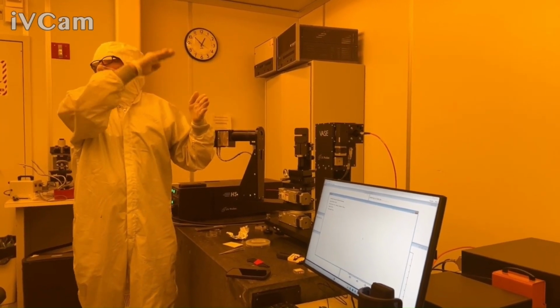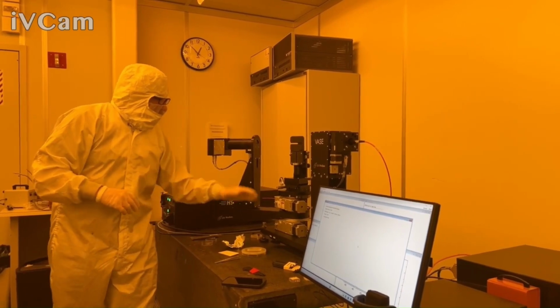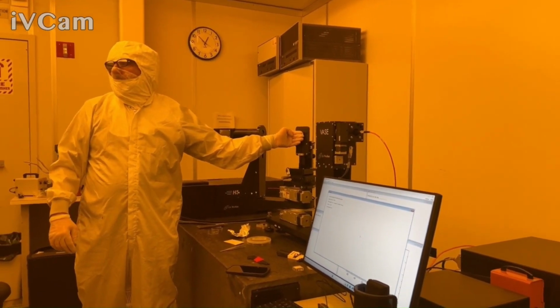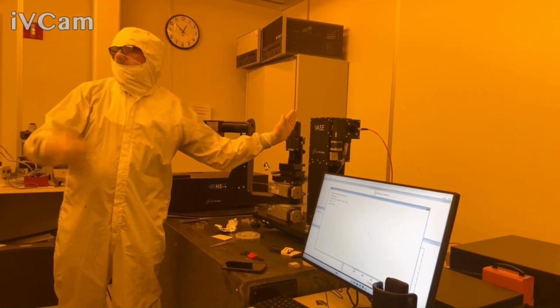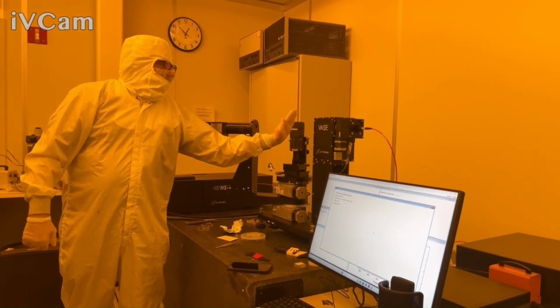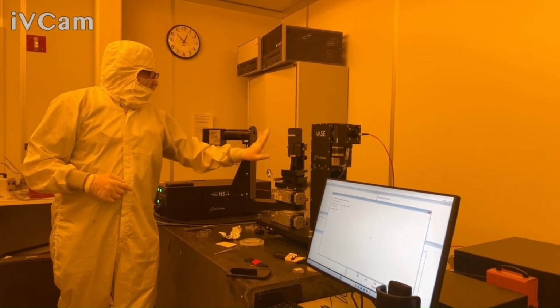That takes long. So one of the things we can do is have your sample up here, your film on glass or whatever it is, and it moves to normal incidence to get the transmission, but it can move back to 90 degrees and get it out of the way to get the air, as long as the stage is back far enough.